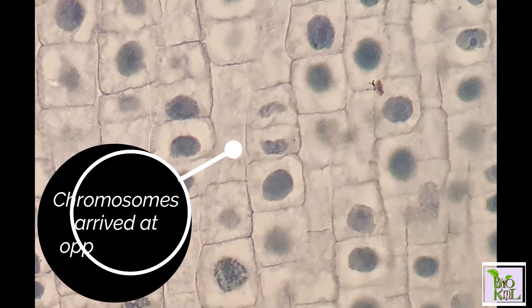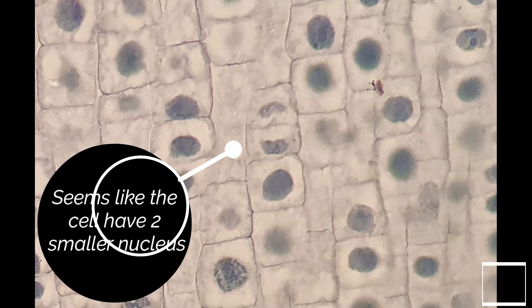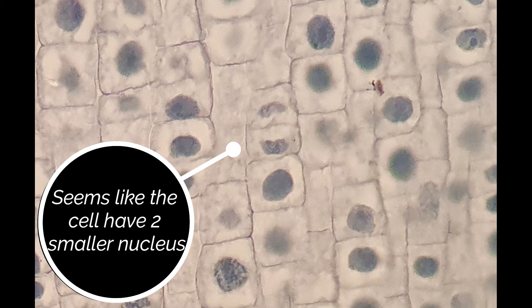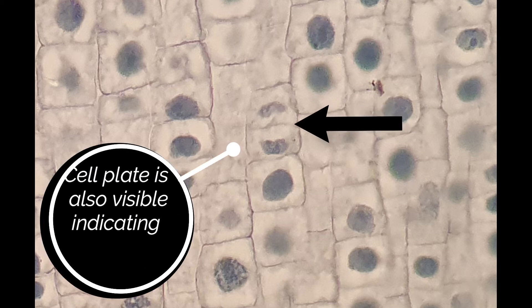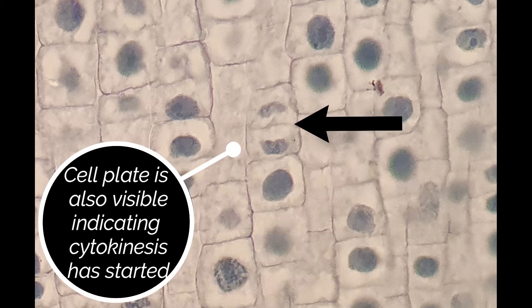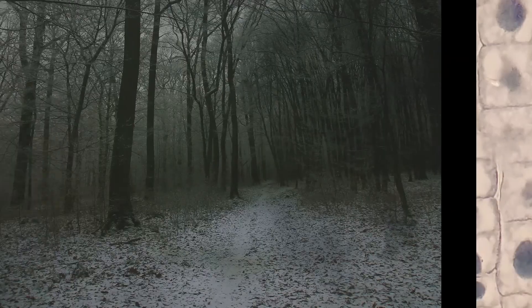At telophase, we can see that the chromosomes have arrived at the opposite pole, and it seems like the cell now has two smaller nuclei. In this example, the cell plate is also visible, indicating that cytokinesis has started.